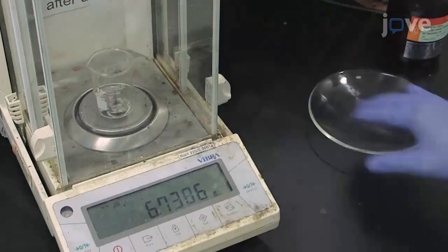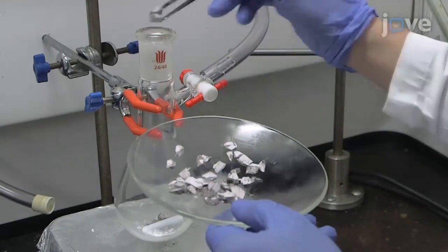Cut the sodium into small pieces and transfer the pieces to the Schlenk flask under a counterflow of nitrogen gas. Immediately seal the flask with the septum.